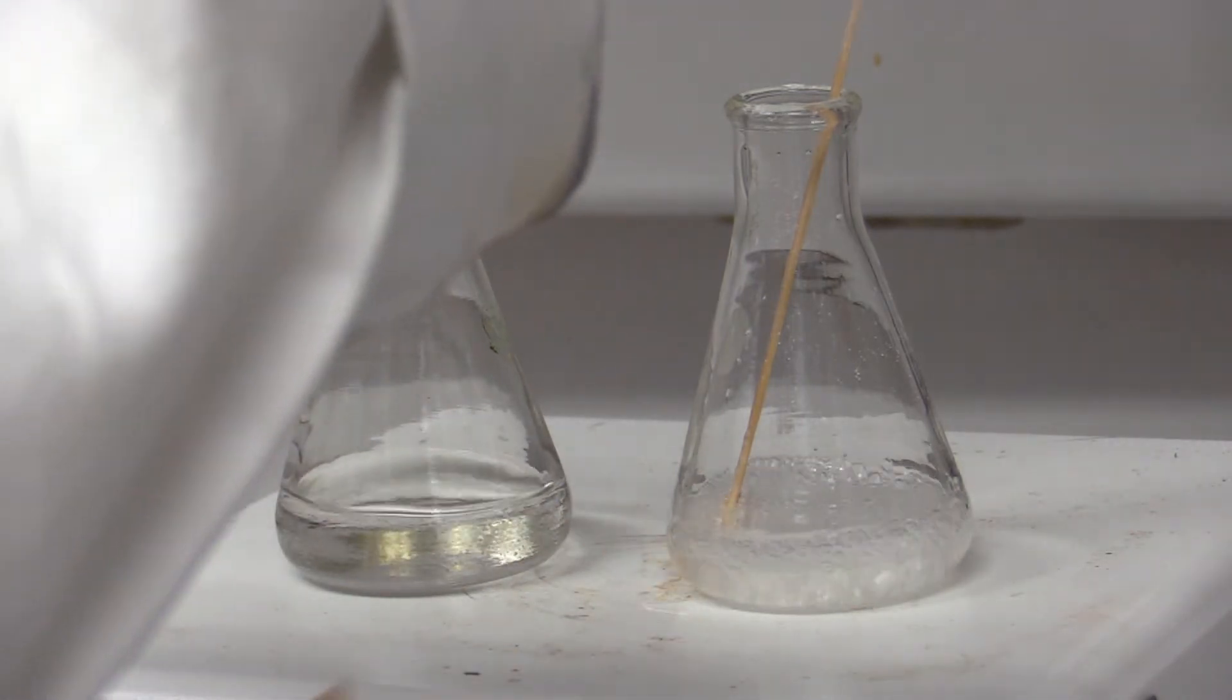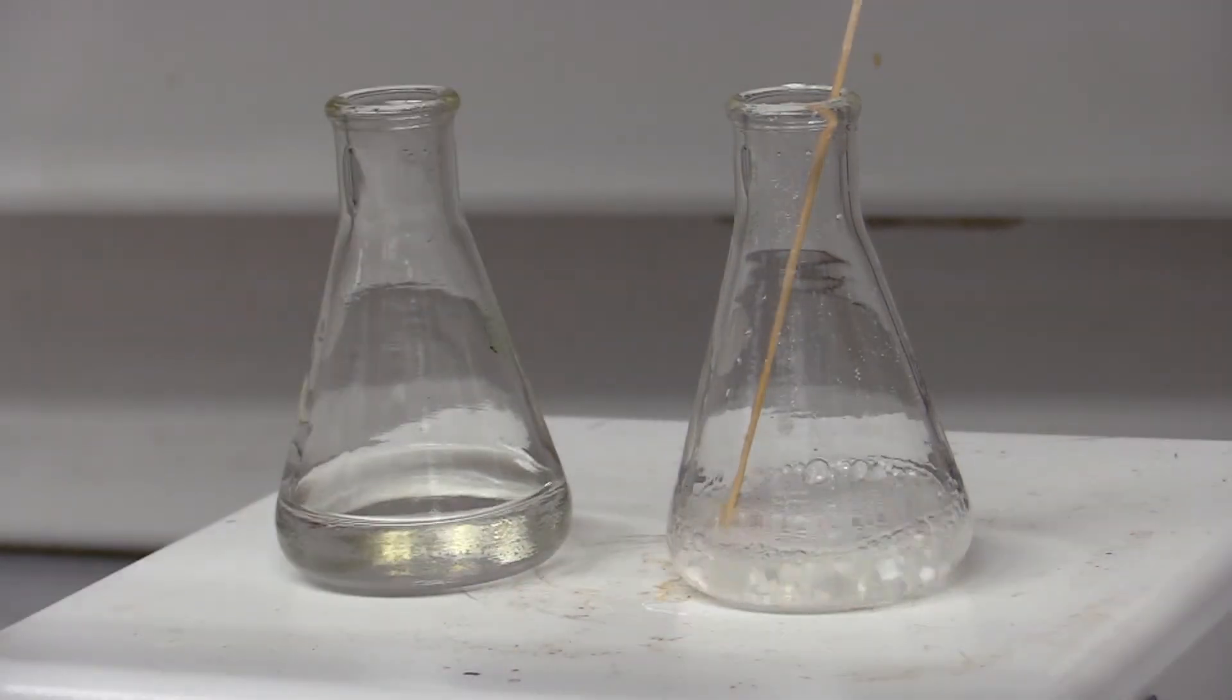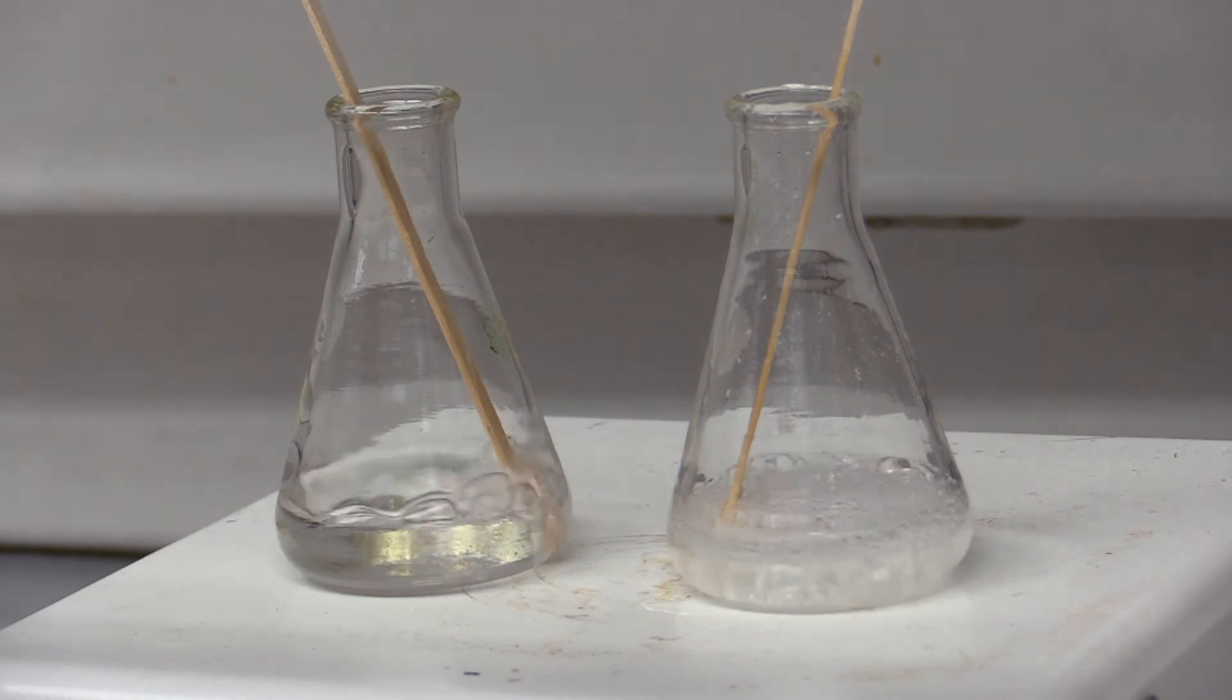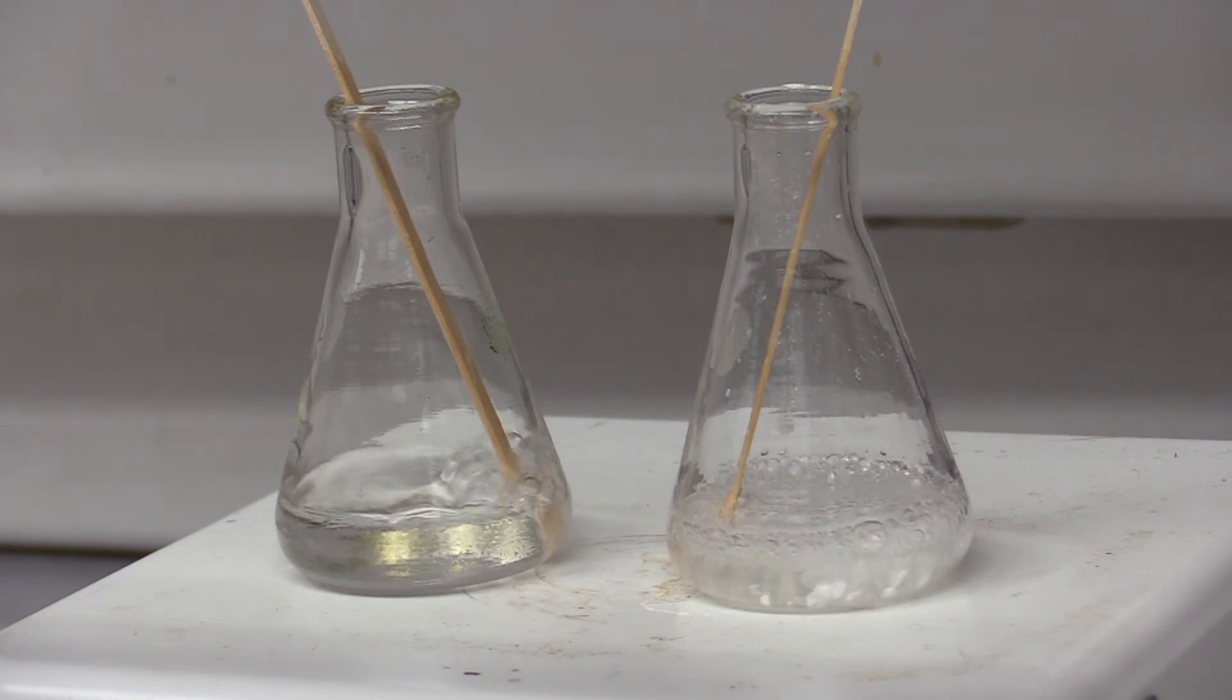After the small amounts of solvents have been added, allow the mixture to come to a boil again and give the cholesterol a little bit of time to dissolve. If it still doesn't dissolve, add more small amounts of methanol and keep stirring.